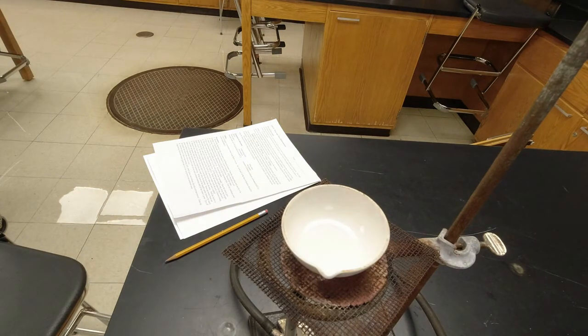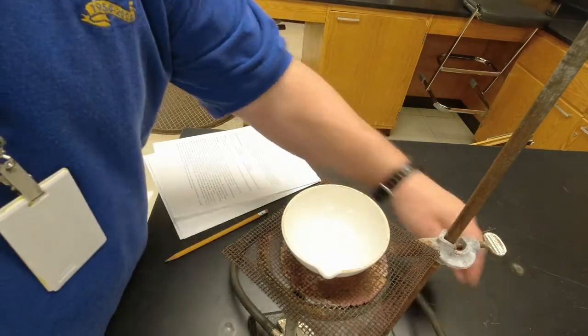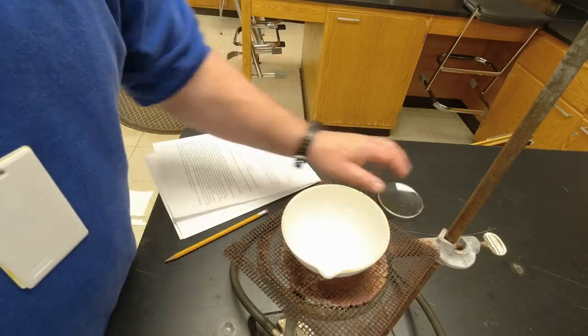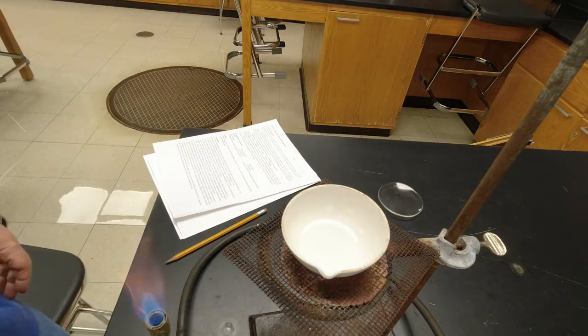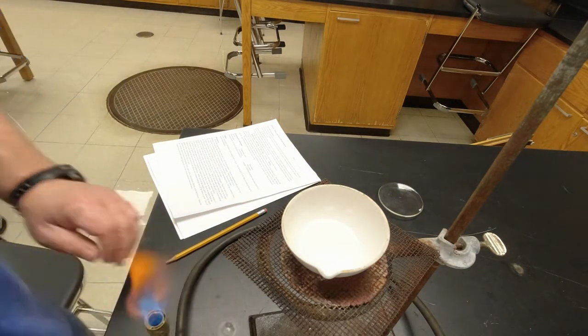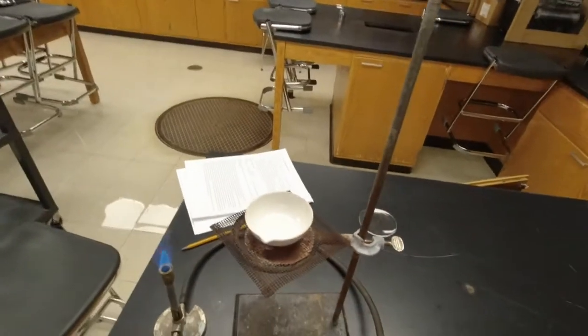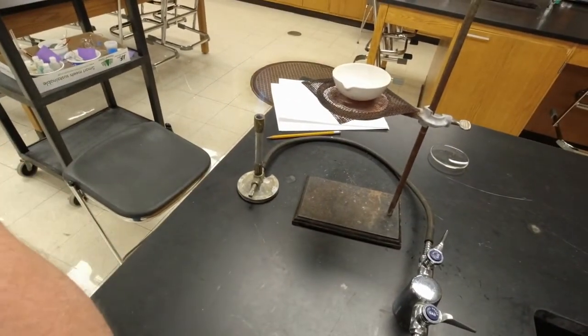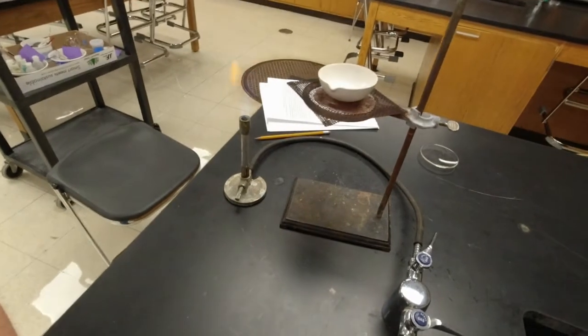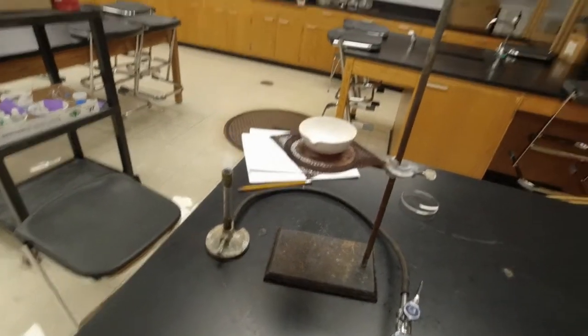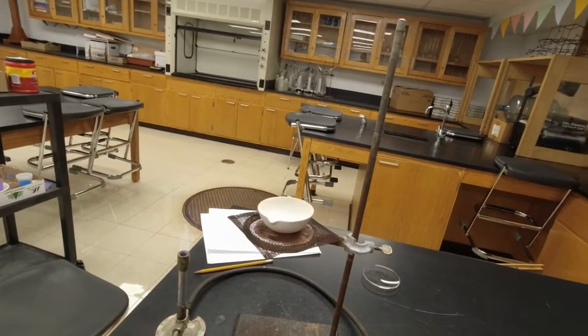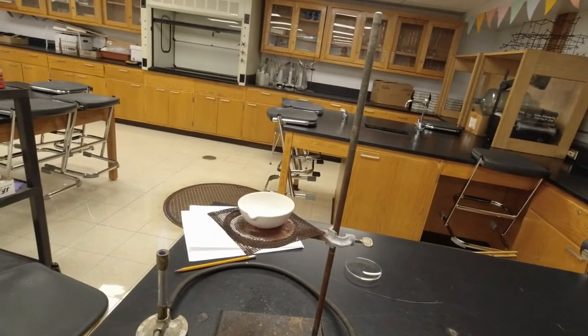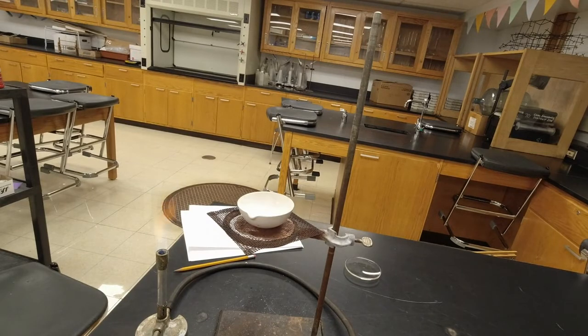I need to wash my hands real quick. So now what we should have left over is just salt and water in there. So what we're going to do is we're going to evaporate this away, and I'm going to move the camera back a little bit here. And what we're going to do is I'm going to slowly evaporate this away.